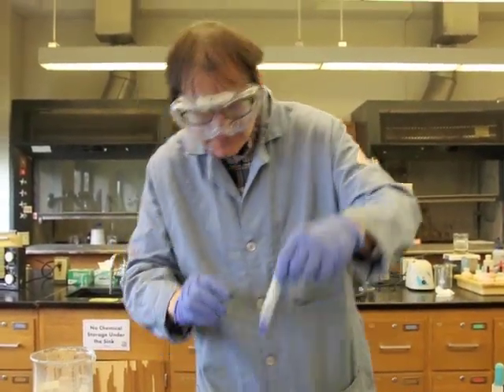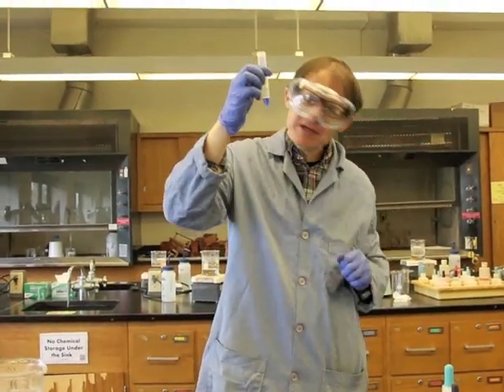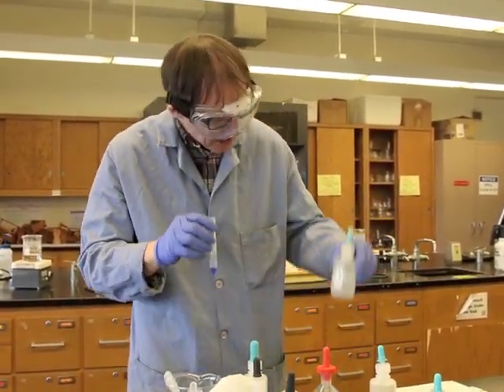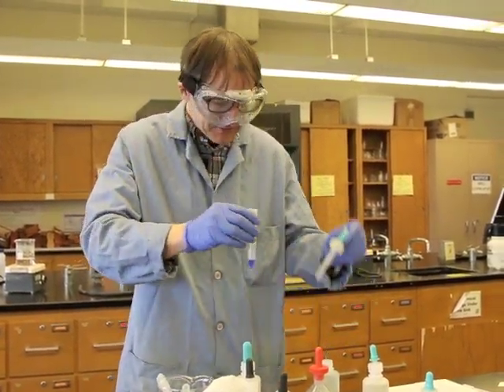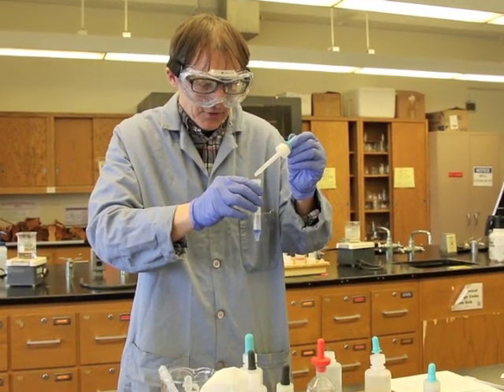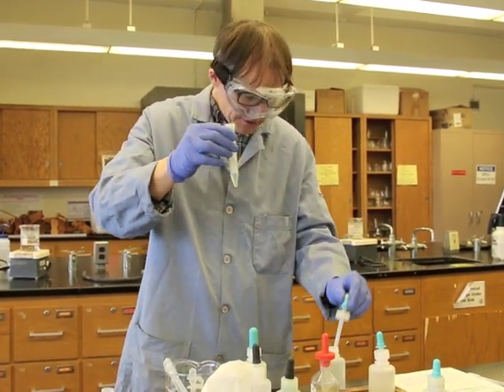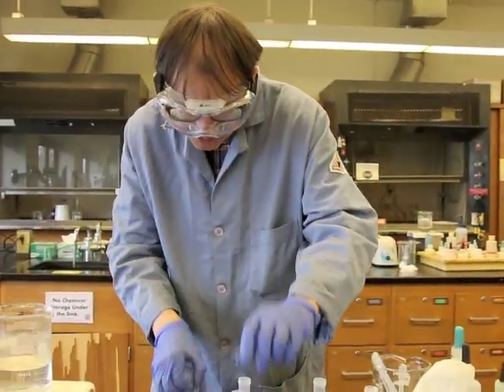Okay. Now, we're going to do the same thing for the unknown. We're going to see if we have silver in there. So again, I'm going to use the 6 molar hydrochloric acid, in order to see if we can precipitate out silver. 1, 2, 3, 4, 5, 6, 7, 8, 9, and 10. There we go.